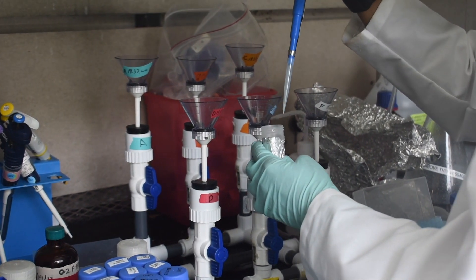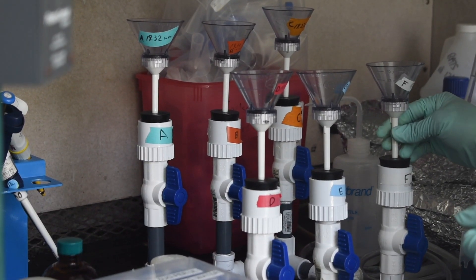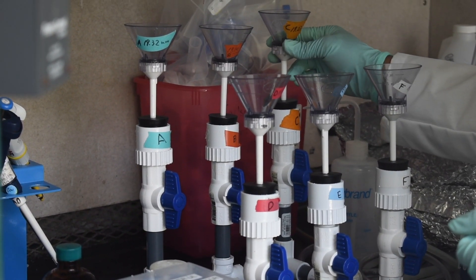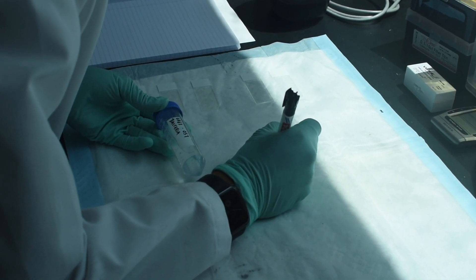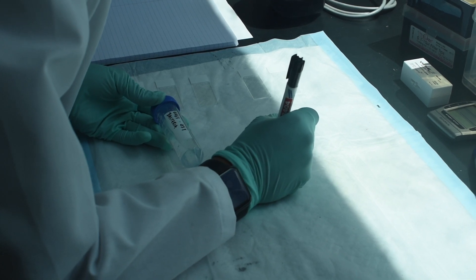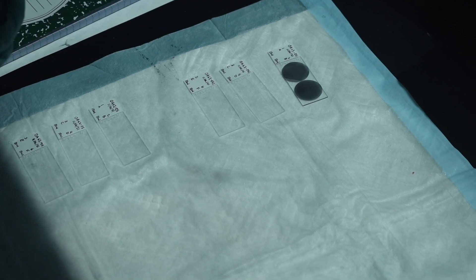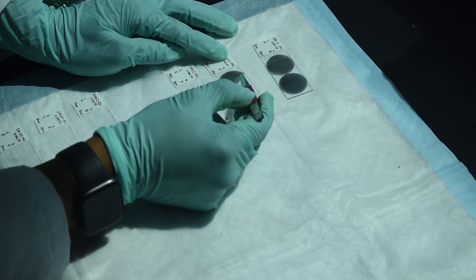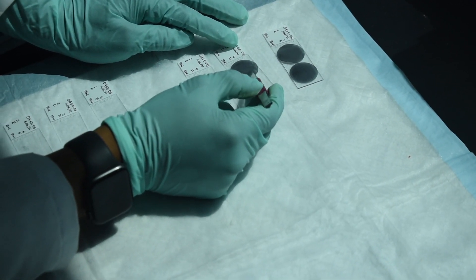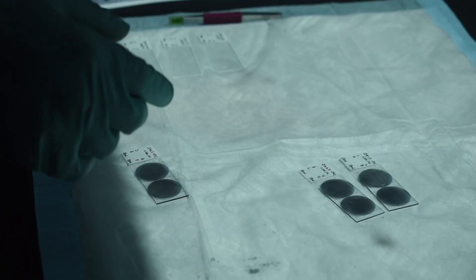Once the 3 minutes is up we drain the DAPI stain through and we then mount the filter. Usually while we're waiting for the water to filter we will label up the slides and get them ready and we mount the actual filter onto the slide using high viscosity oil and then a cover slip before we go to the microscope.